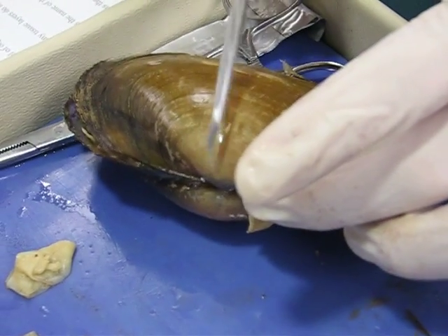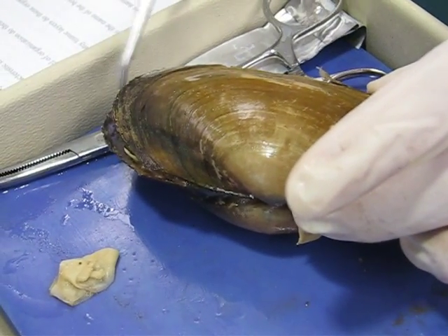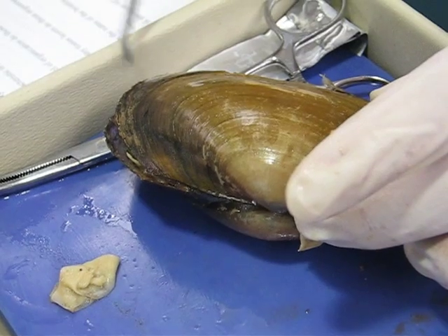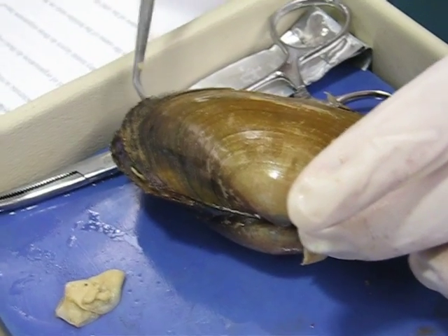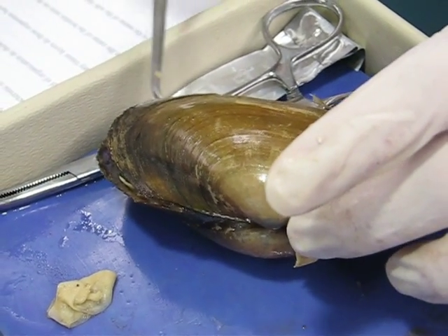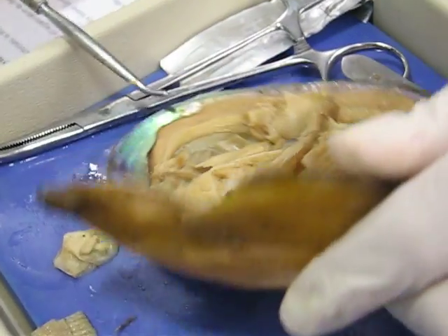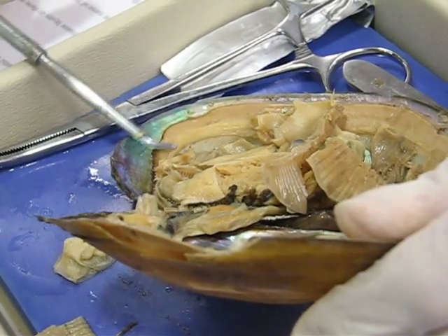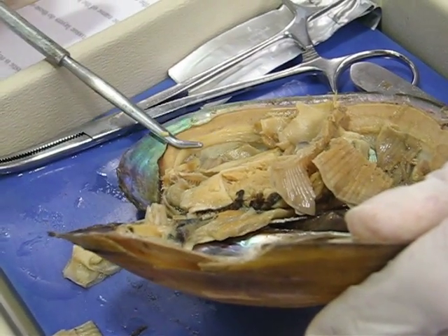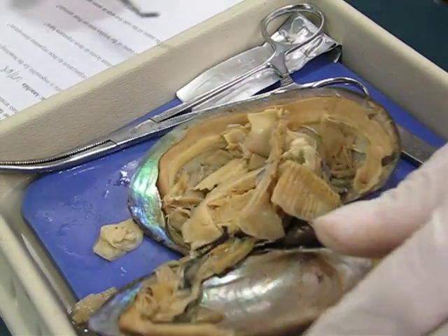So if the umbo is here, then the siphons are over here and sort of dorsally here, or ventrally towards the bottom. This is going to be the incurrent siphon and the excurrent siphon up on top.